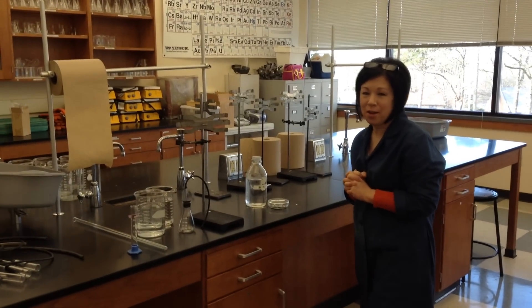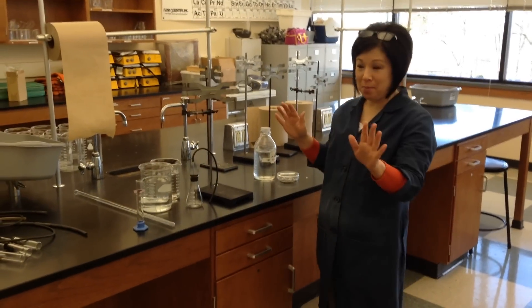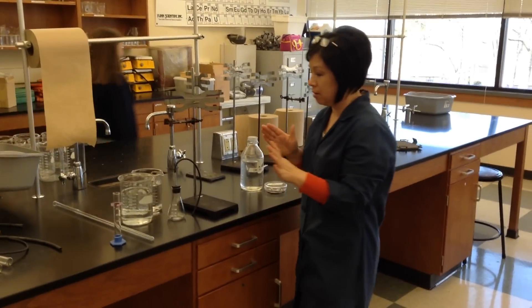Alright, start whenever you're ready. Hello. Okay, so in the interest of time, we're going to try to demonstrate all these techniques to measure reaction rates.